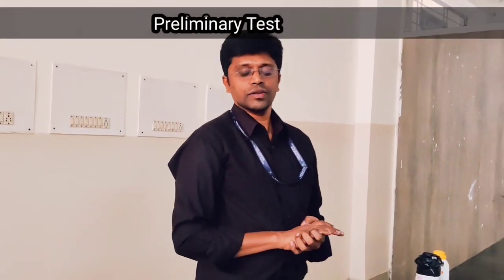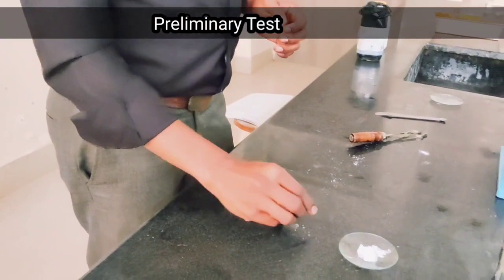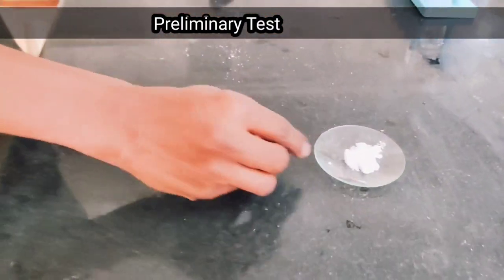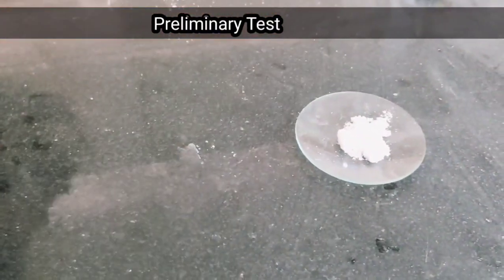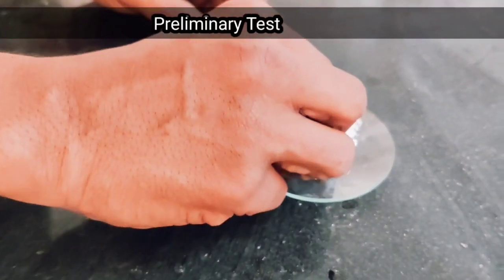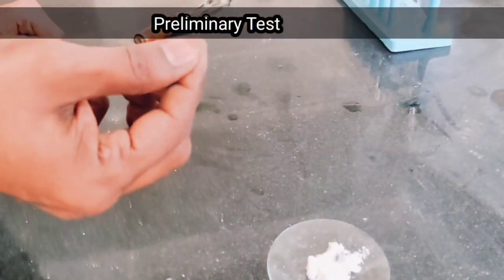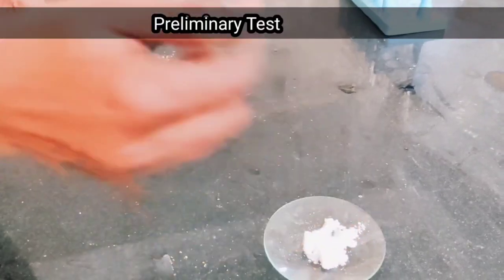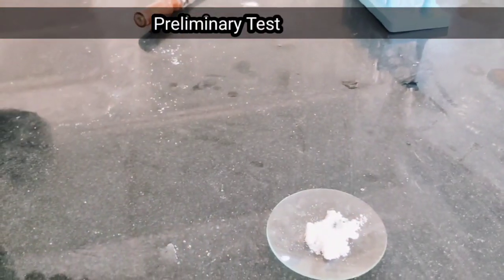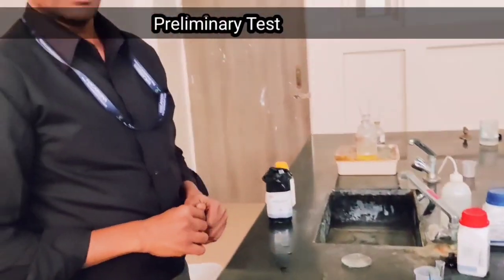We can start with the preliminary test. The first test will be the physical appearance. We have to check whether it is crystalline or amorphous. If it is crystalline, we can feel the crystalline form when you touch it with the bare hands. So we can predict it is crystalline. The color of the salt is white.